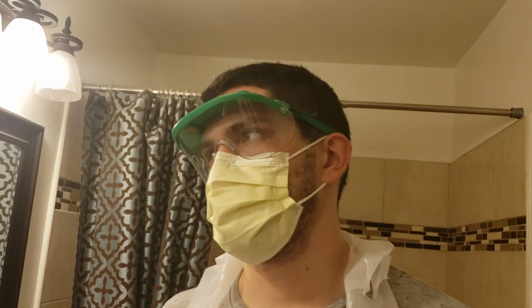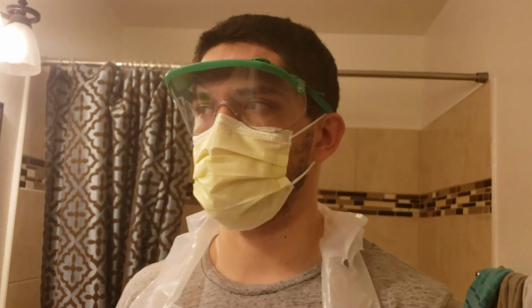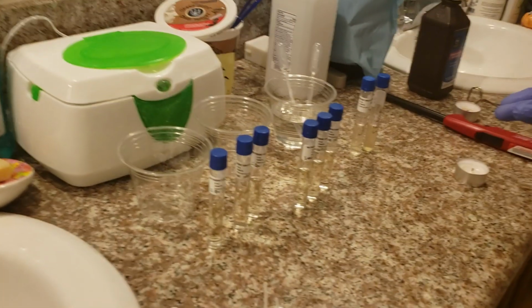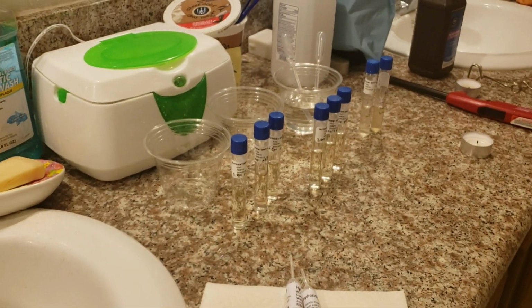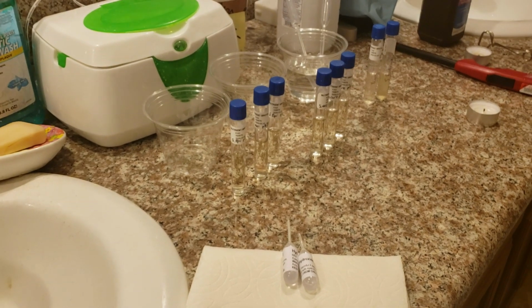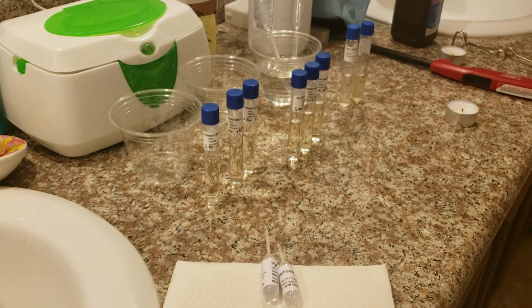This is part 2 of the lab experiment for the week where we look at environmental influences of microbial growth. This particular part of the experiment is exercise 2, which is salt tolerance and pH testing. If I can draw your attention to the area here, as you can see, I've already taken the liberty of doing my best to label all of this stuff out.